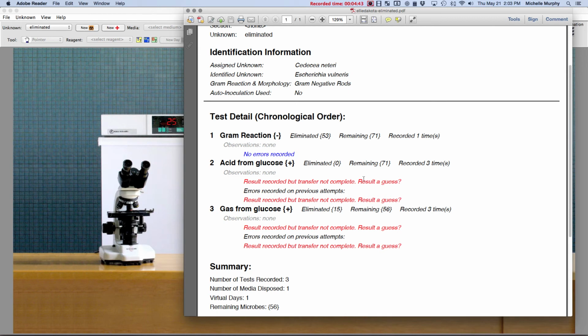In this case, it can tell me I didn't actually do the test. I just guessed, because it told me I guessed twice.